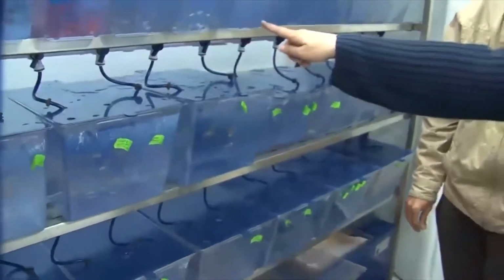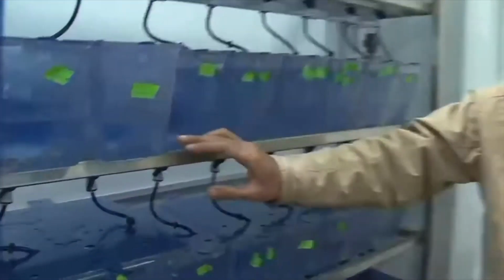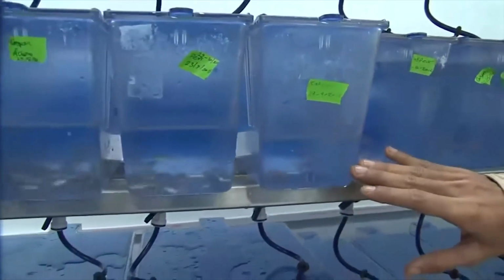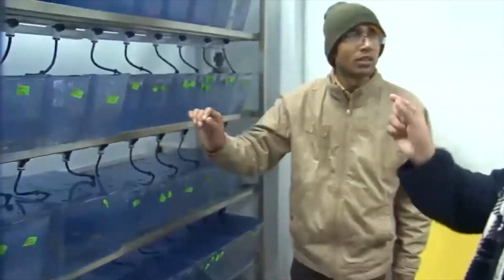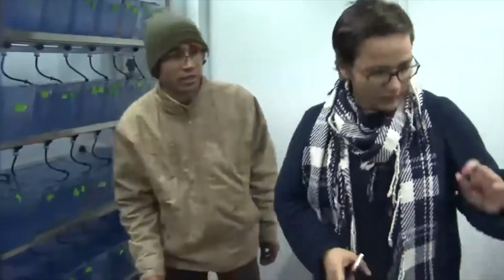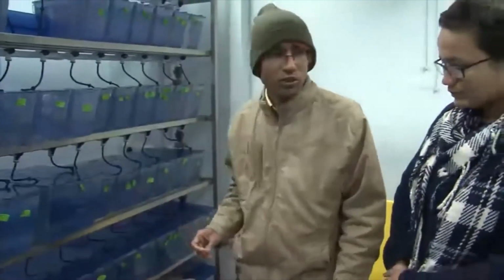And this one is a Casper model. Basically, the skin is transparent in this model, so all the internal organs are visible without doing anything. In a live organism, you can see the liver and other organs. Can you show us one fish, to see this transparency of the body? Sure, I can. So, give me a moment.